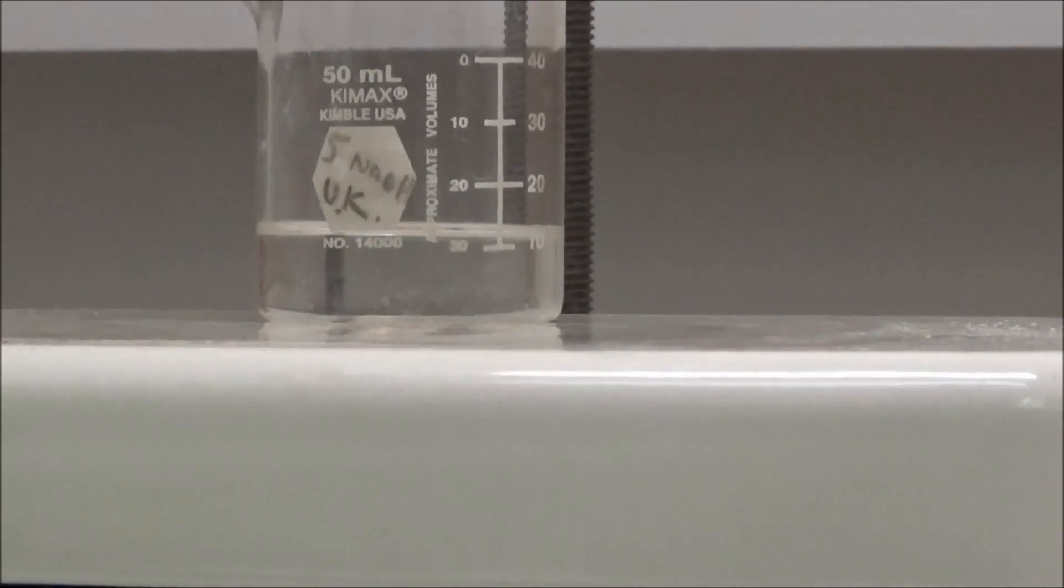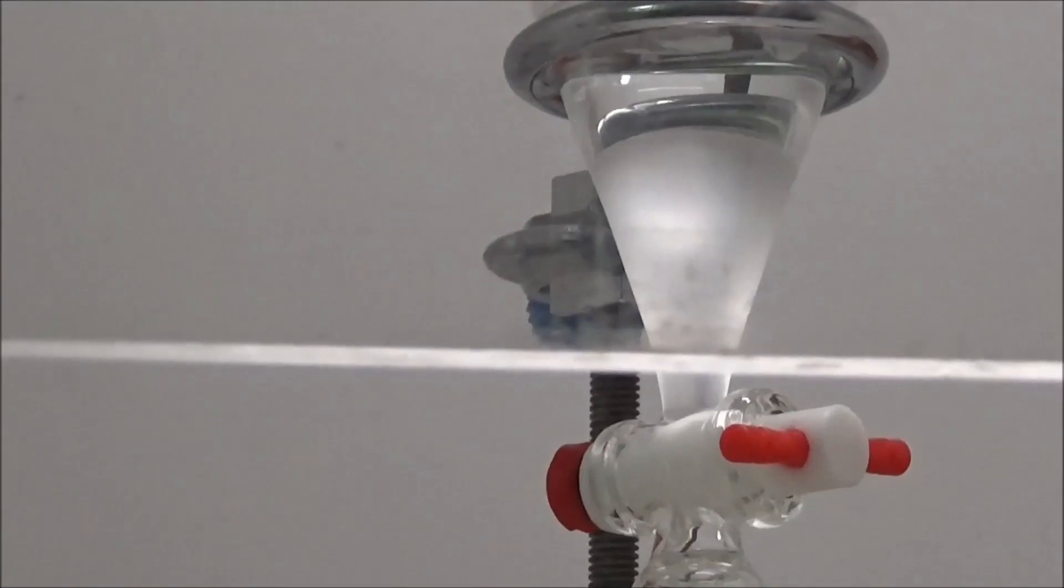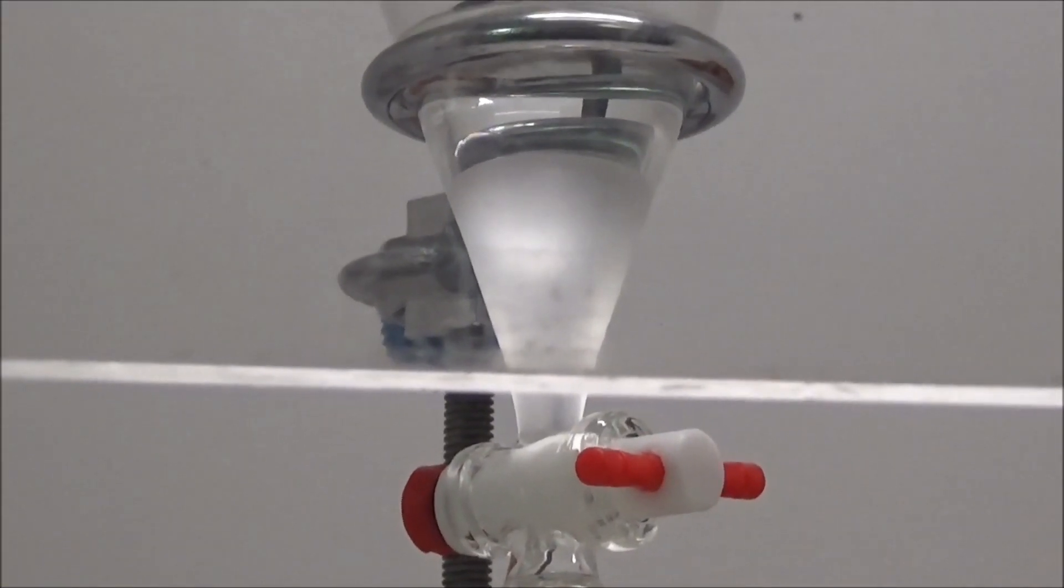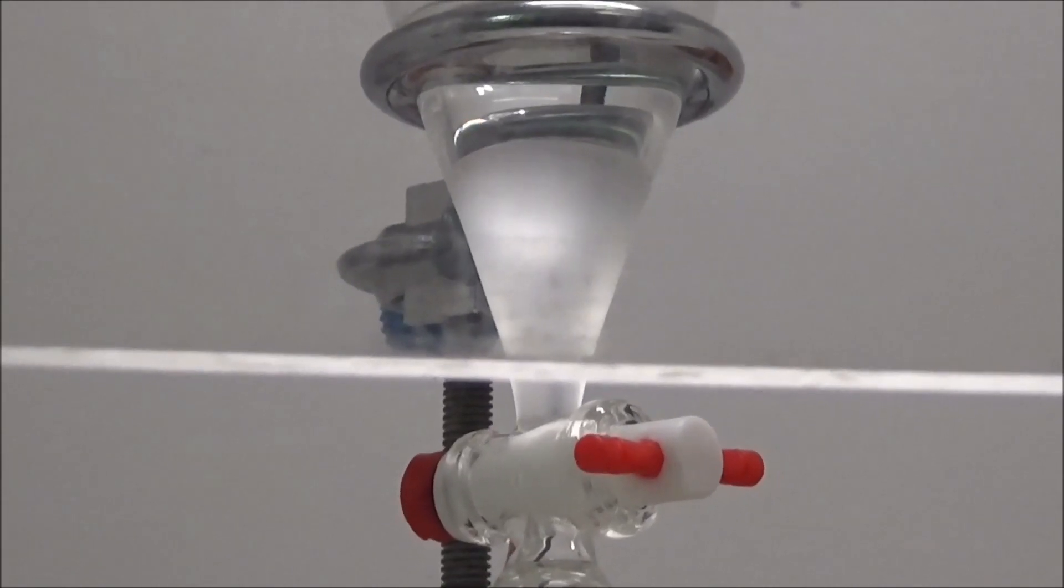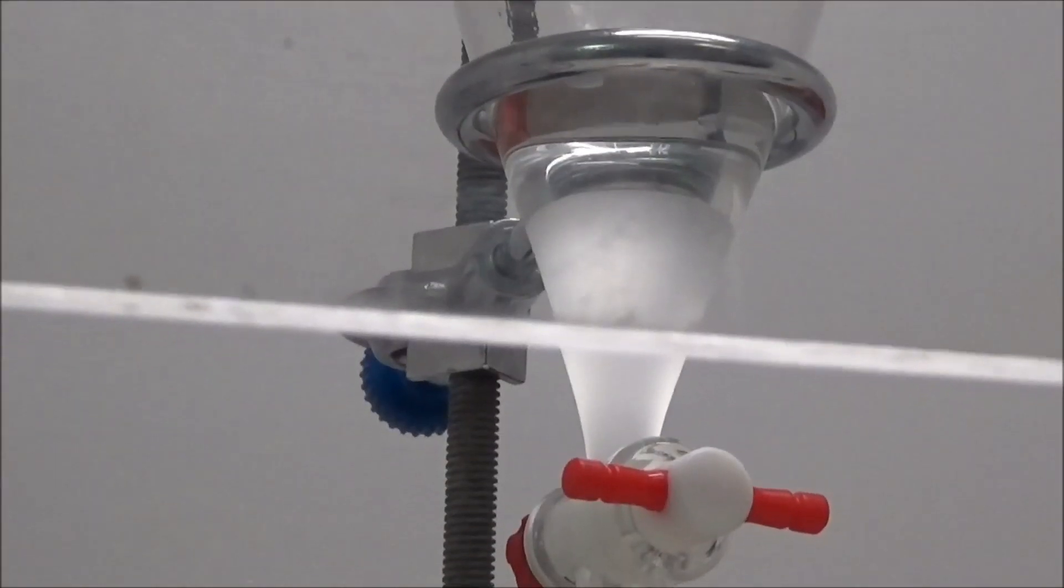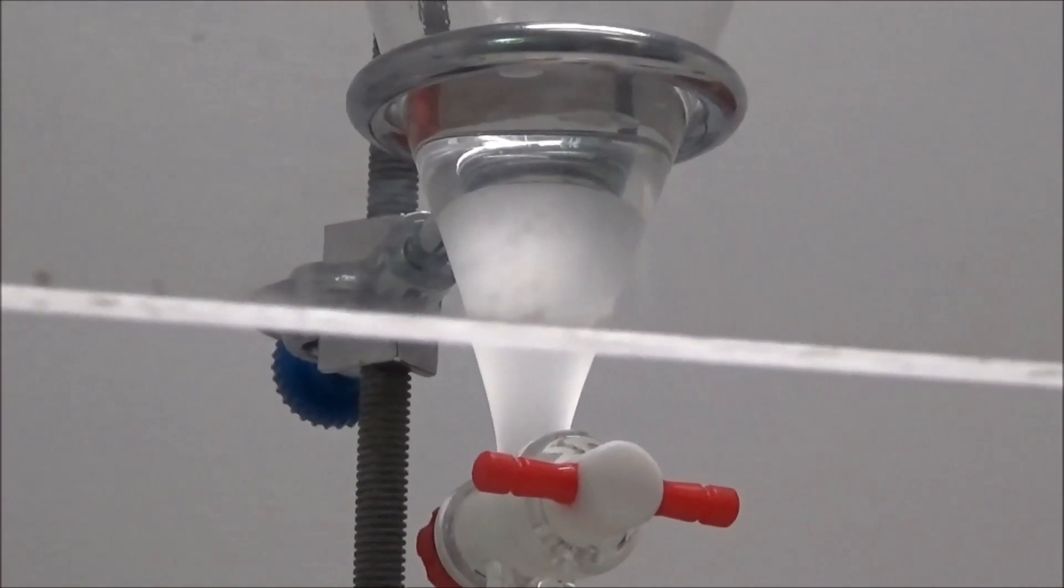It was then washed with water, hydrochloric acid, water, sodium bicarbonate solution, and lastly water. These steps aren't included because I have a feeling that all of my viewers know how to use a separatory funnel.